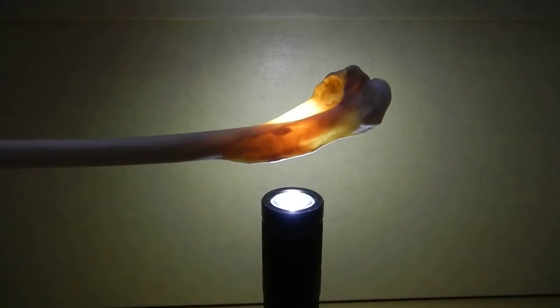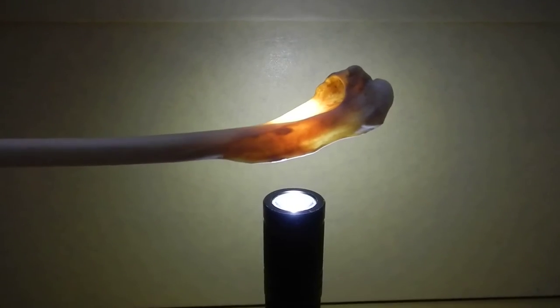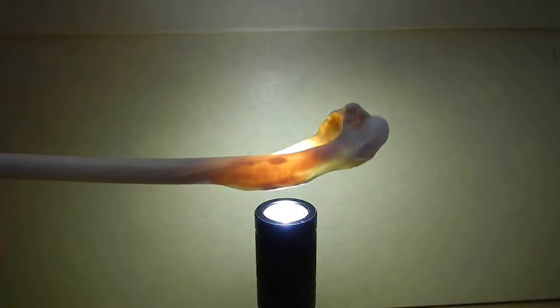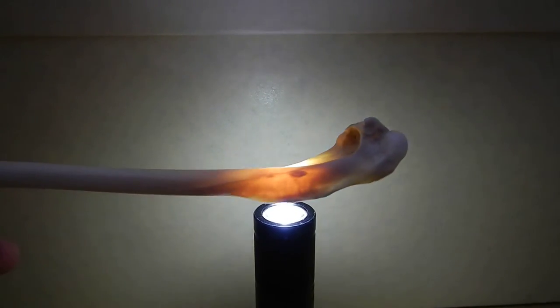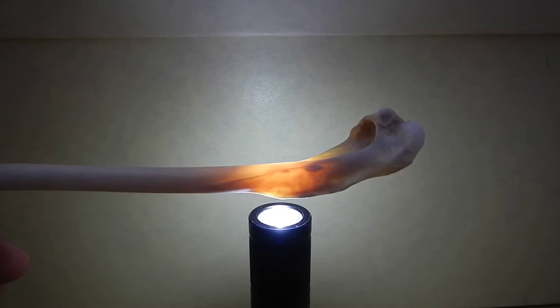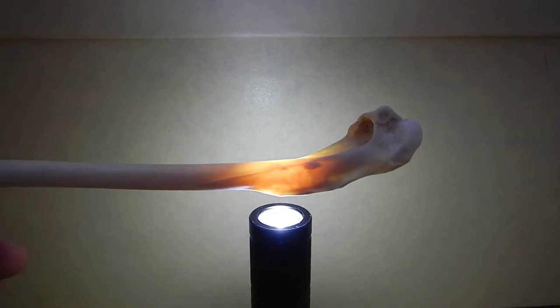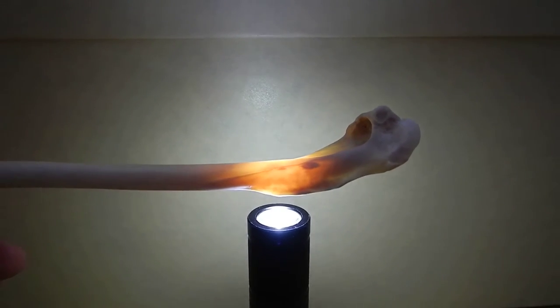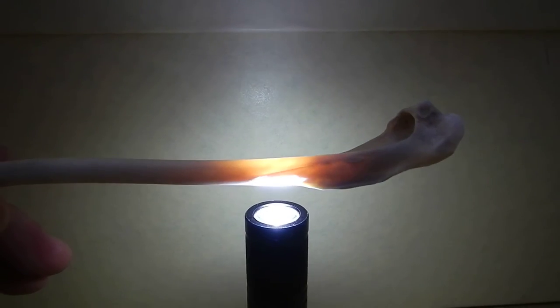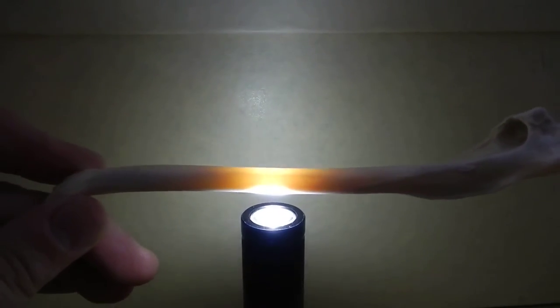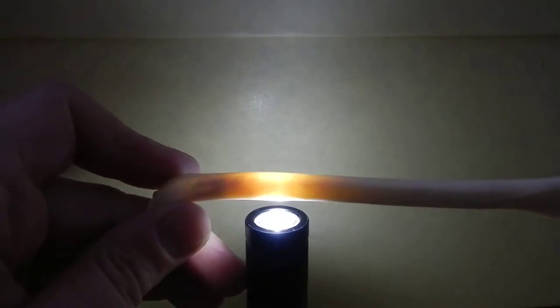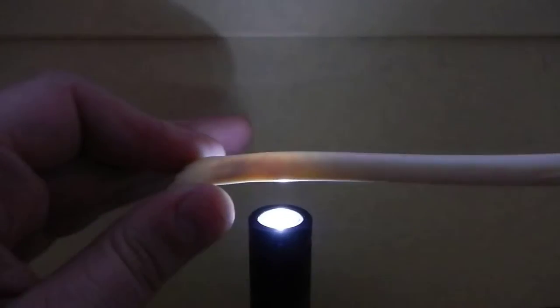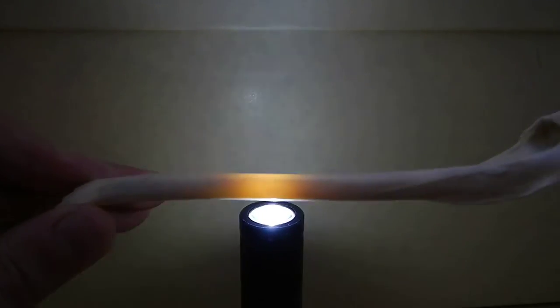So in bones that don't have any medullary bone in them, like this humerus, if you hold them over a pretty high powered flashlight, you can see that it glows. The bones are pretty thin walled and there's nothing in there, so it has this translucent quality. And as you run the bone down over the flashlight, you see it glows pretty much the entire way down.